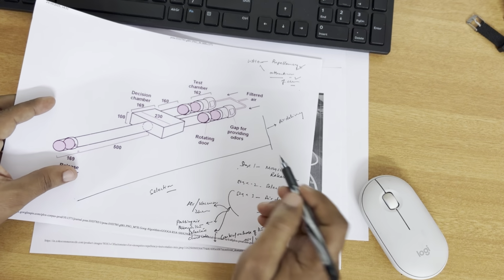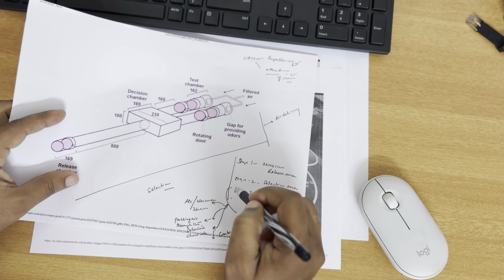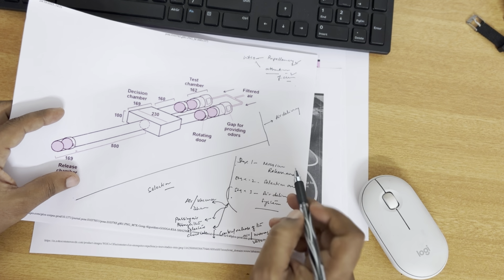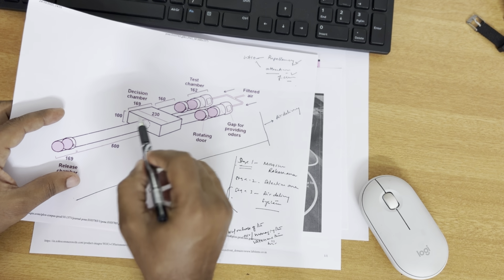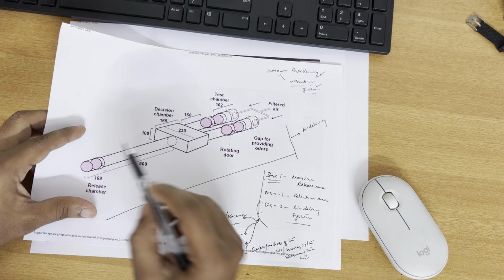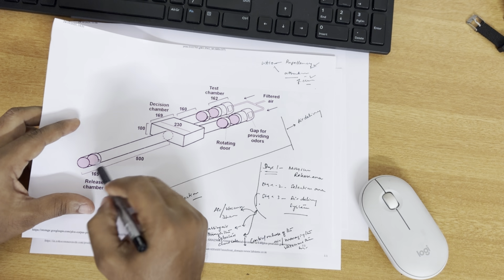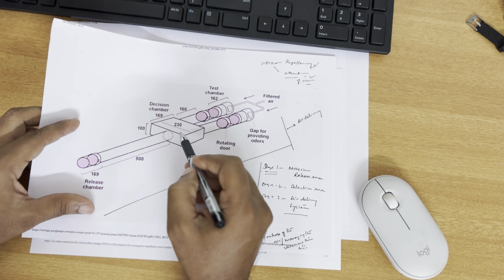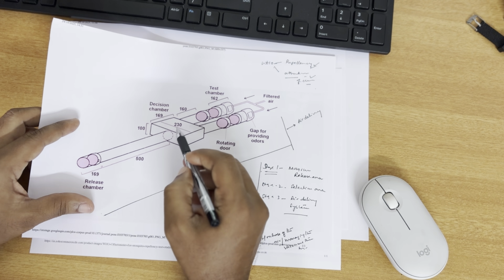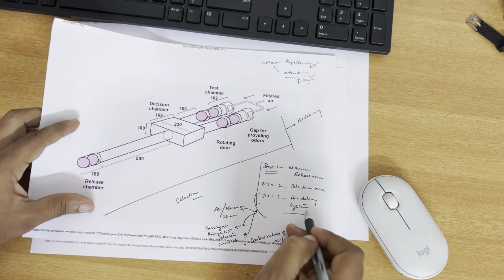The olfactometer can be divided into three stages. This is roughly how it's been divided so that you can understand what we mean. Stage one is the mosquito release area. So here we release the insects. Stage two is the selection chamber. The released insects go into the selection area. After that, the air delivery system.